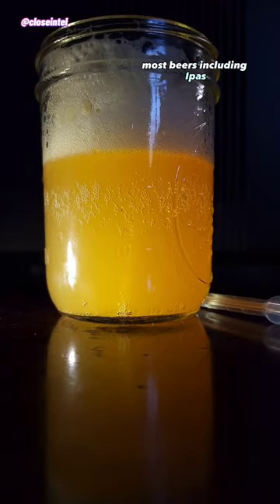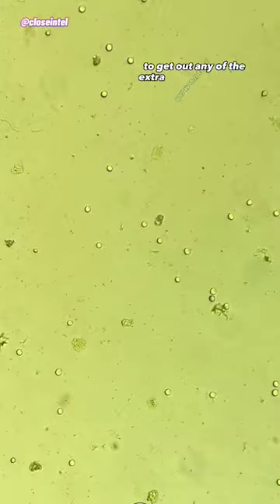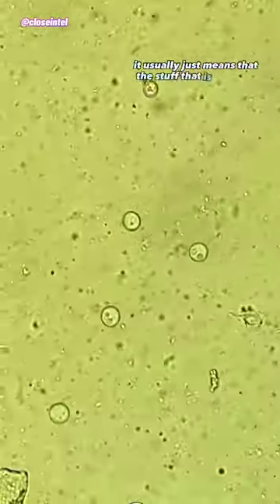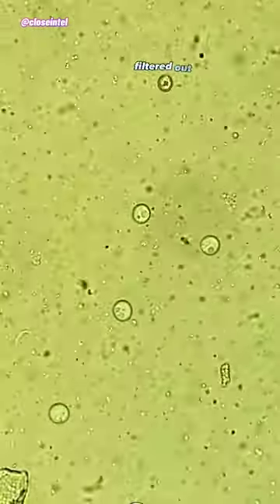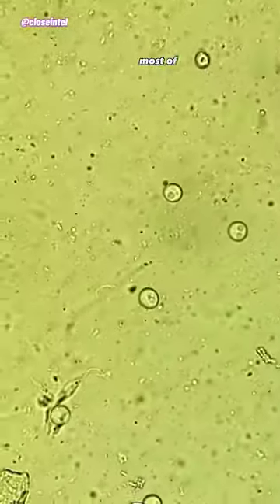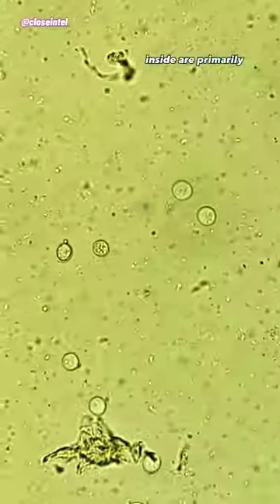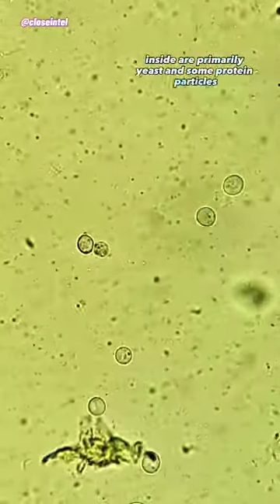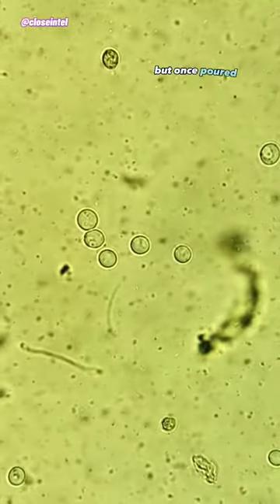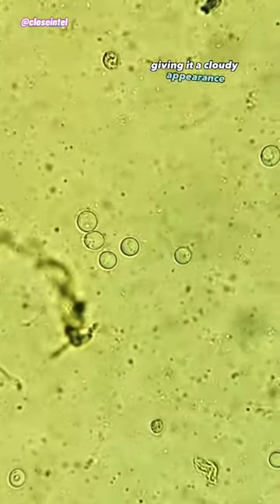Most beers, including IPAs, go through a filtration process to get out any of the extra unwanted debris. When a beer is hazy, it usually just means that the stuff that is typically filtered out is left inside the drink, which gives them their name and their cloudiness. Most of the sediments that you'll see floating around inside are primarily yeast and some protein particles. The yeast will typically lie at the bottom of the bottle, but once poured, the yeast and other debris will resuspend in the drink, giving it a cloudy appearance.